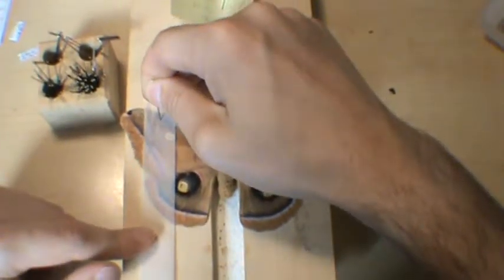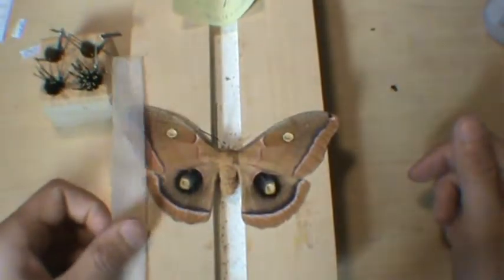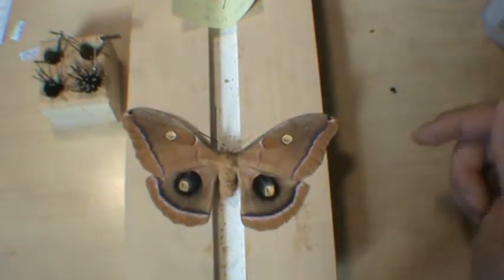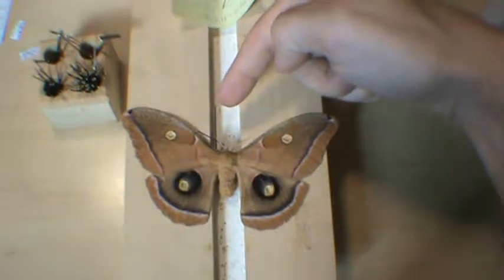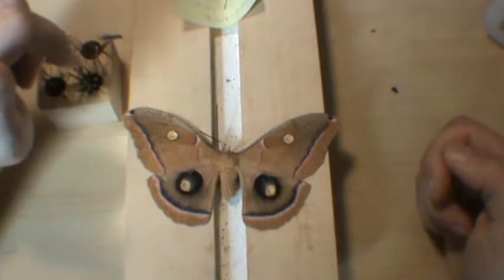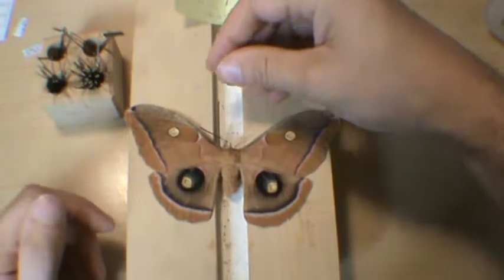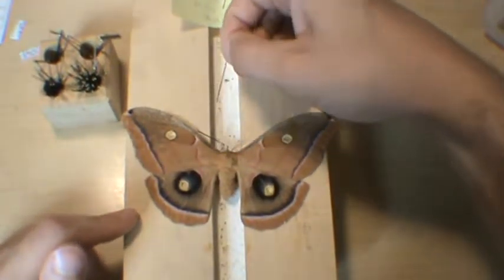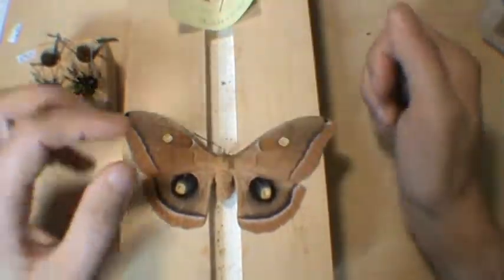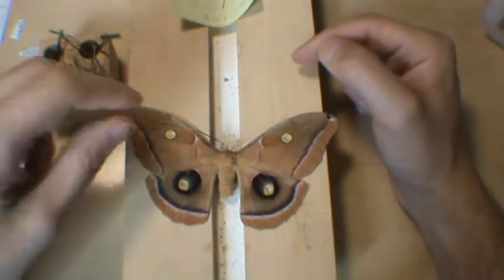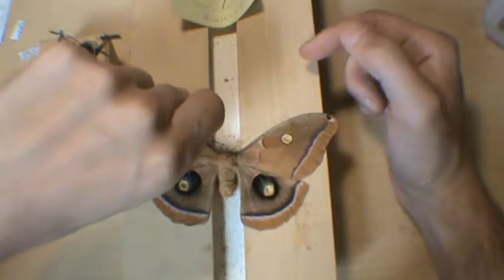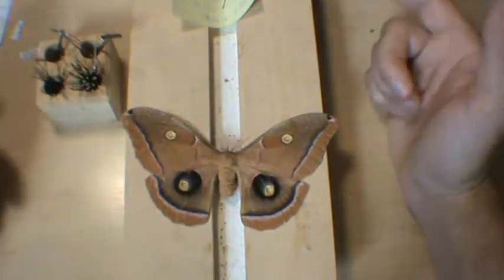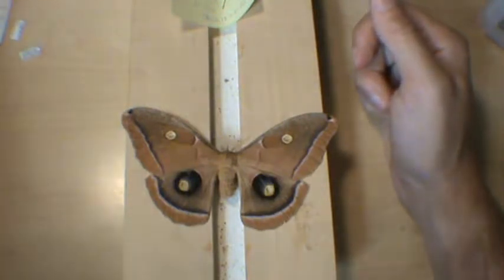Easy does it. I get amused easily. Easy, don't damage. We've still got some pins right here. I put these pins here to help hold that left antennae up, to get both antennae about the same on the same plane. These are fragile stuff. Look I got it. Maybe this side. It's kind of like a game of pick up sticks, isn't it? Here we go. Don't damage it. Got it. Yay.